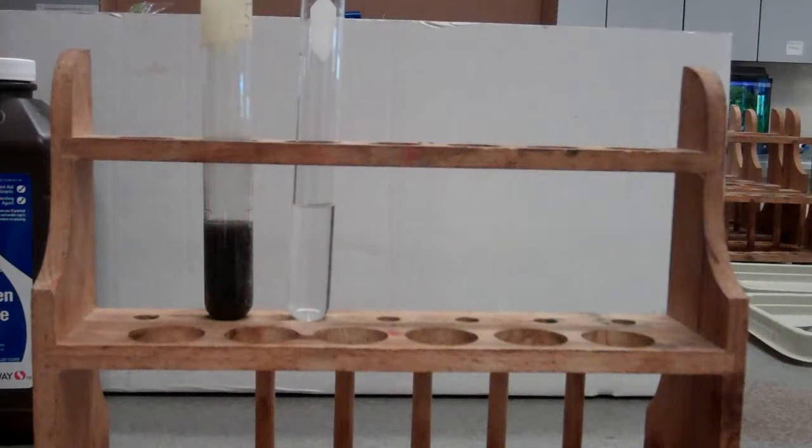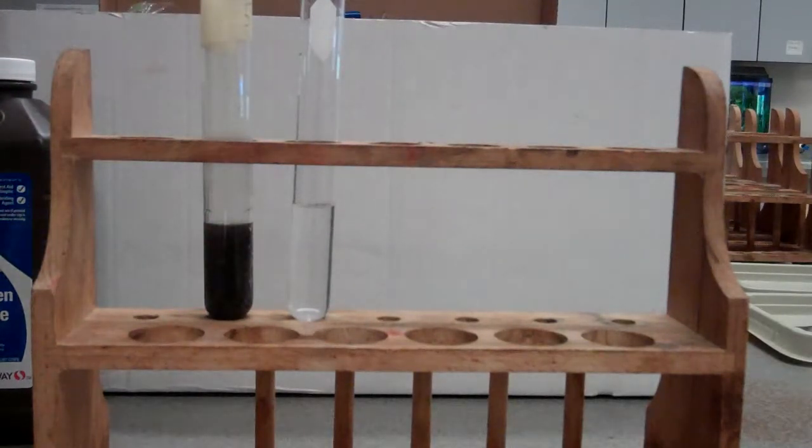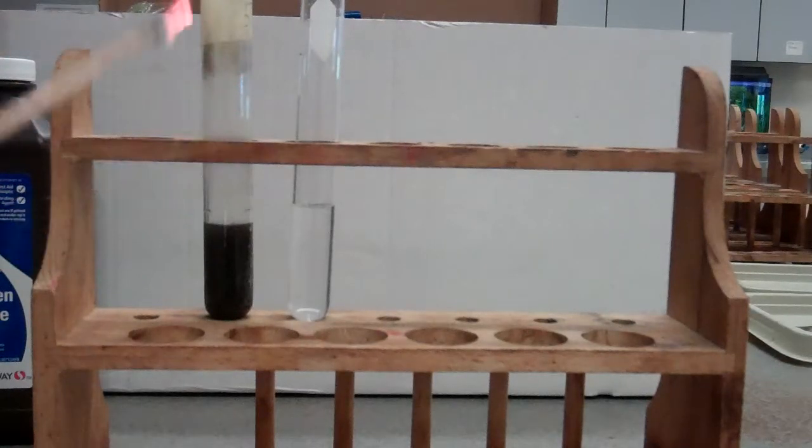So now what we can do to test for trying to figure out maybe what these bubbles are, we can use a very common test here. And we can take our splint and we can put it in there. And the fire comes back. So we get that fire coming back.